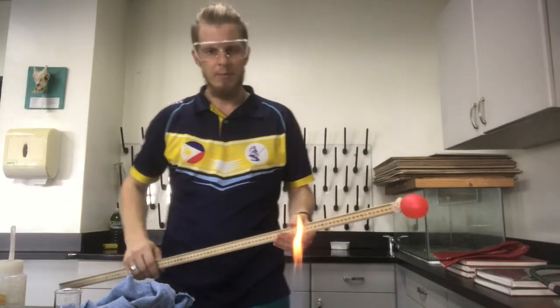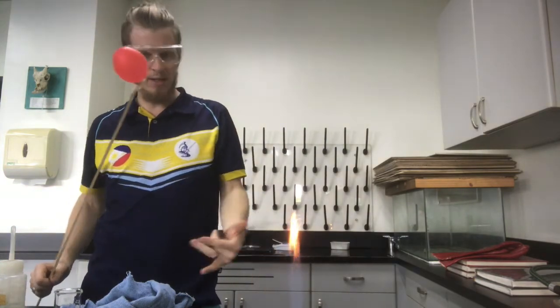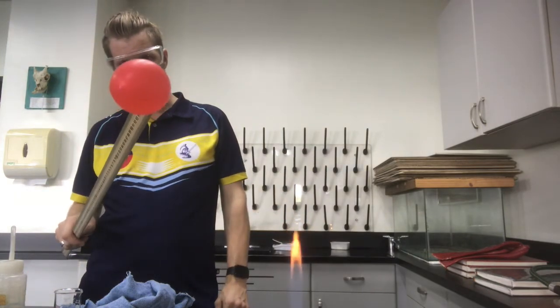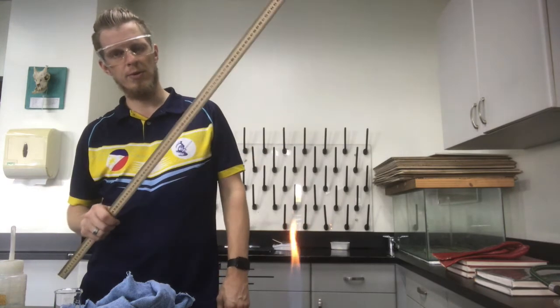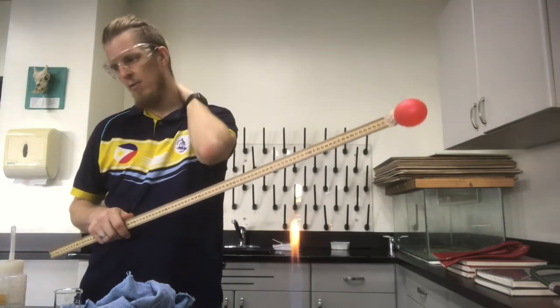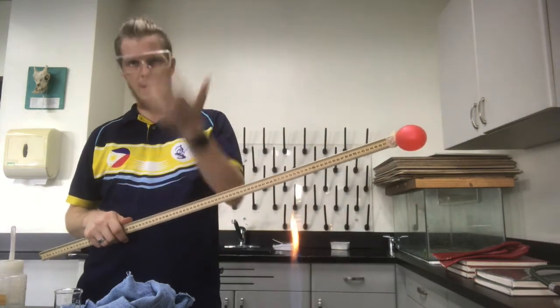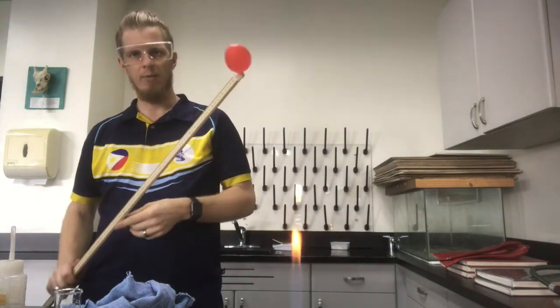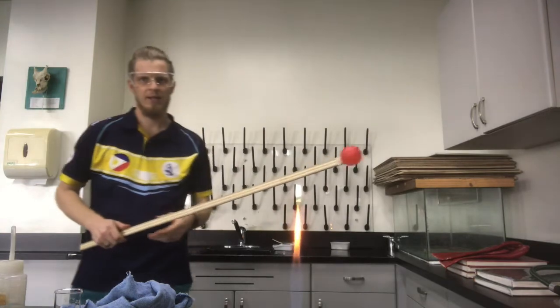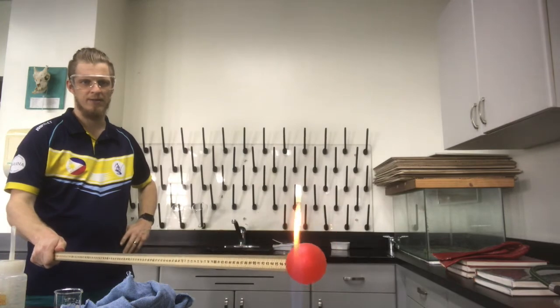Okay, welcome back. So what I've done is the same single replacement reaction that we did before with magnesium and hydrochloric acid, and I tried to fill this balloon with some hydrogen. Hydrogen reacts with oxygen. It combusts. This is the fuel they use for space rockets, and with the right mixture it will burn and give thrust for the rocket, and with the wrong mixture it will explode. And that's kind of what I'm hoping for here. So hopefully we get a bit of an explosion. Let's find out.